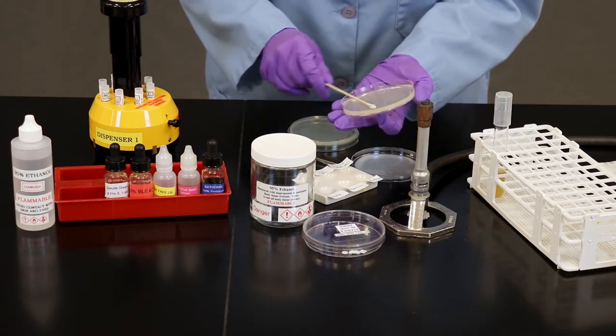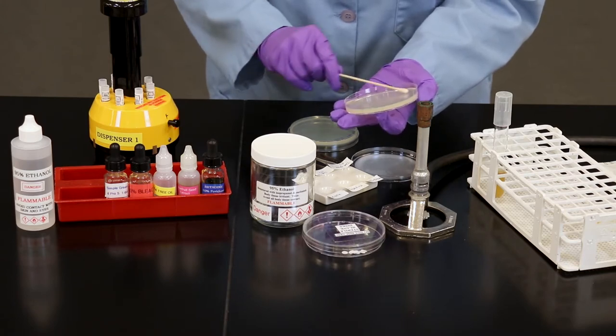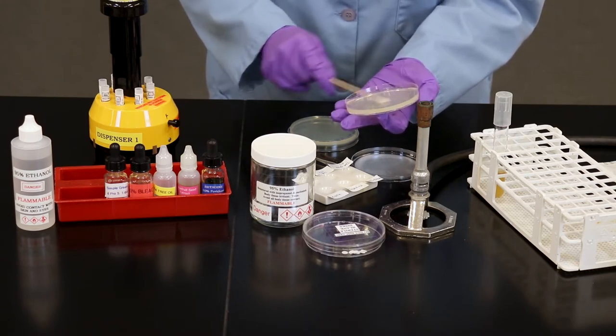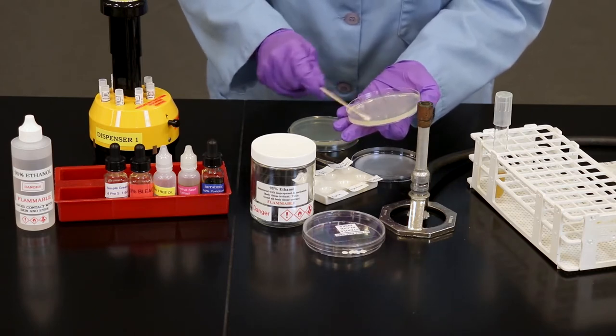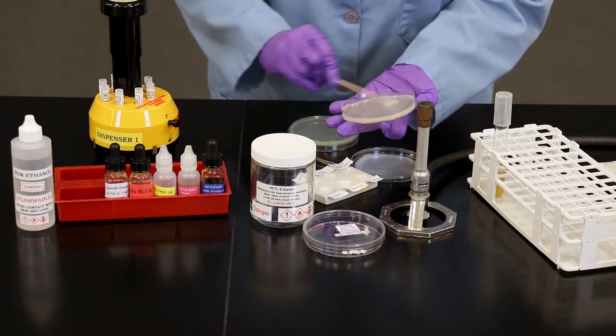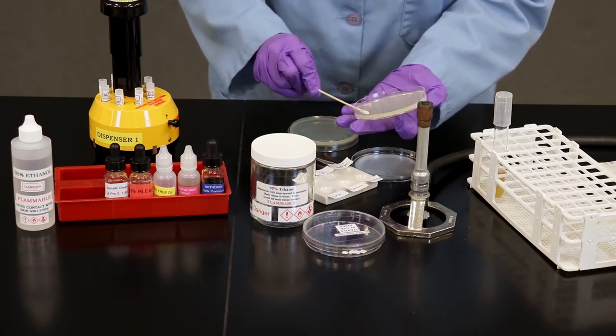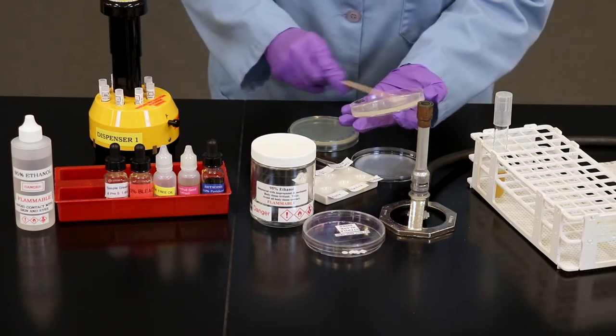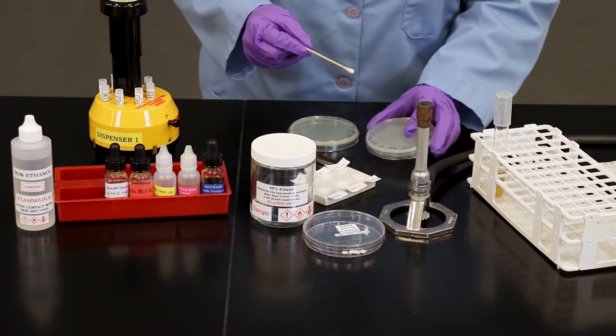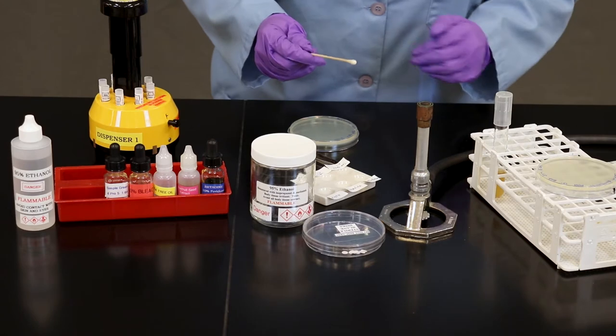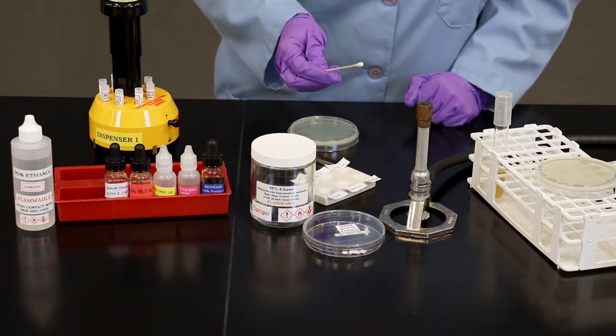It's really important for this lab that the whole surface of your agar is completely coated in order to appropriately view your results later. Place down, back on your lid. At this point, you can dispose of the swab in the biohazard.